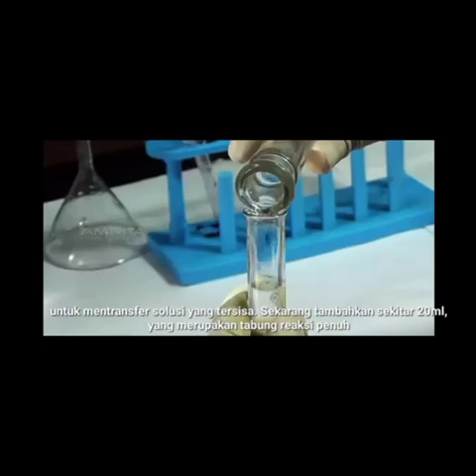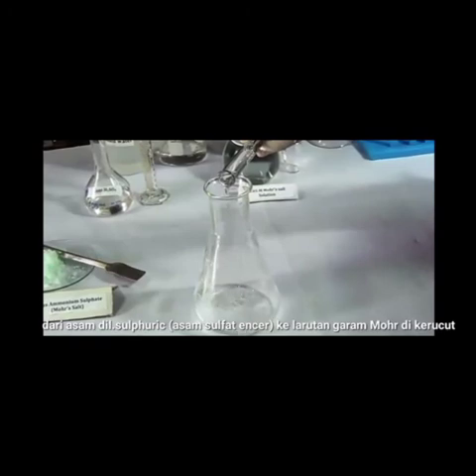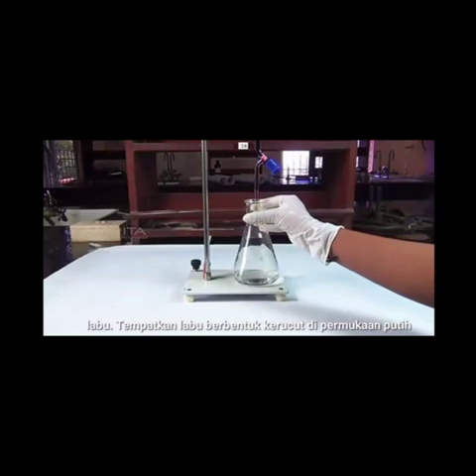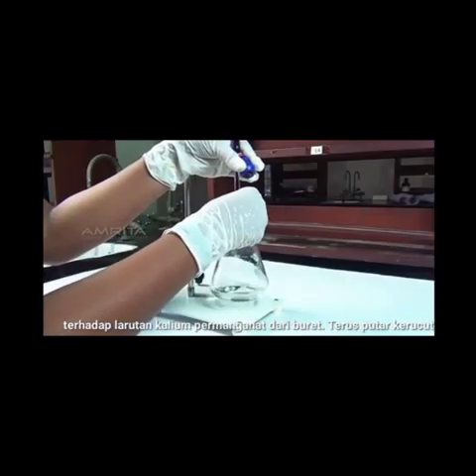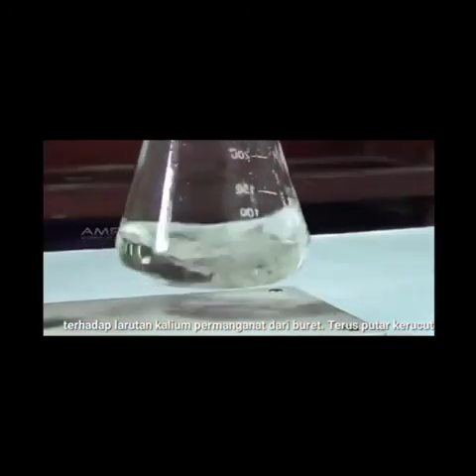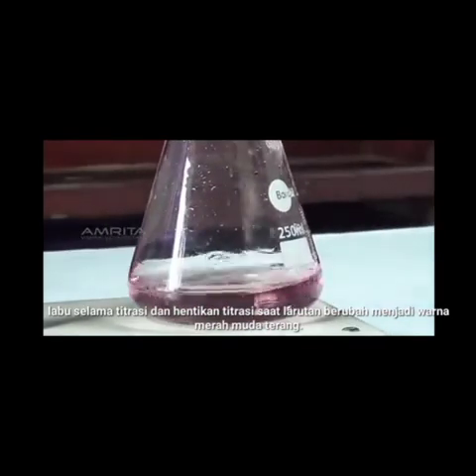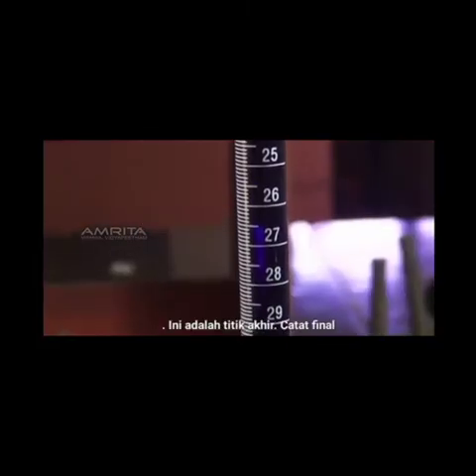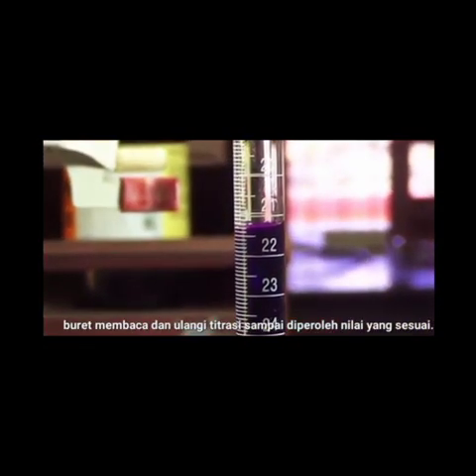Now add about 20 ml, which is a test tube full of dilute sulfuric acid, to the Mohr salt solution in the conical flask. Place the conical flask on the white surface of the stand under the burette. Titrate the solution in the conical flask against the potassium permanganate solution from the burette. Keep rotating the conical flask during the titration and stop the titration when the solution turns to a light pink color. This is the end point. Note down the final burette reading and repeat the titration until concordant values are obtained.